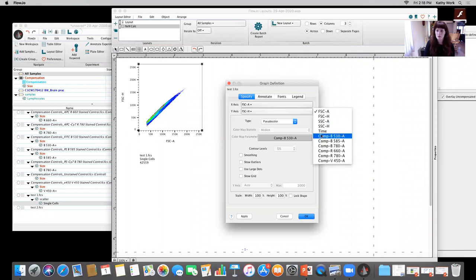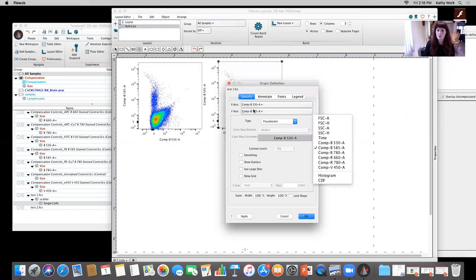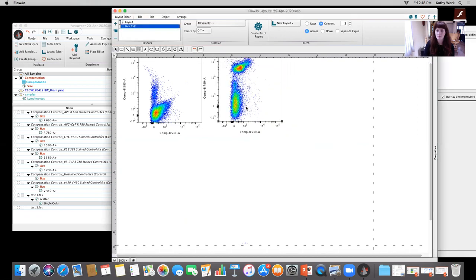I'm going to change it to be B530 and B585. Okay. We tend to delete this little text box right there because I don't need it. Duplicate this, carry it over. And then I'm going to change this to B780. It's the name of their detector.